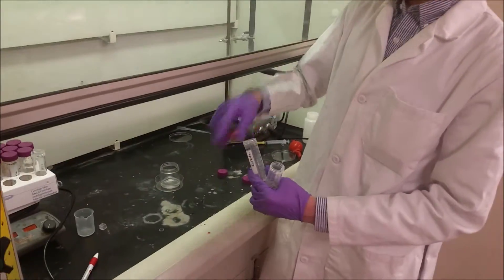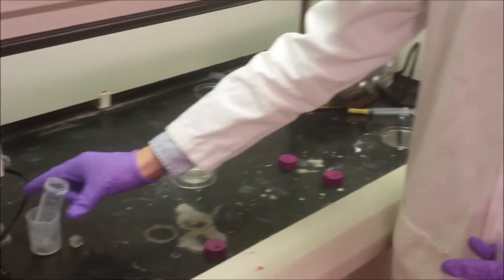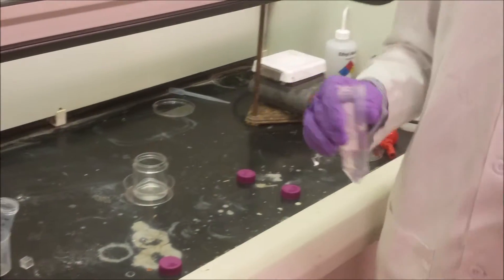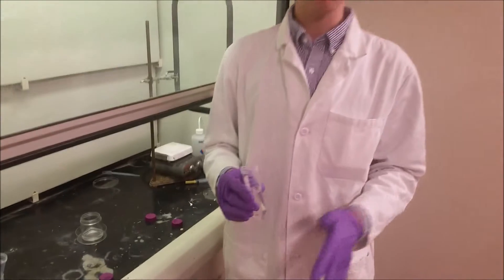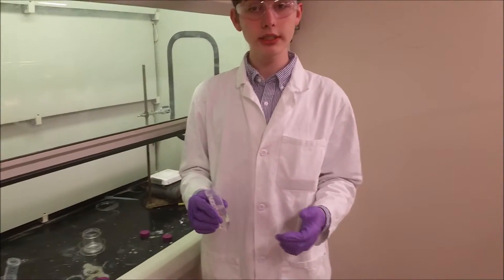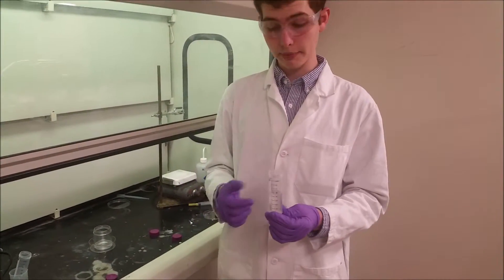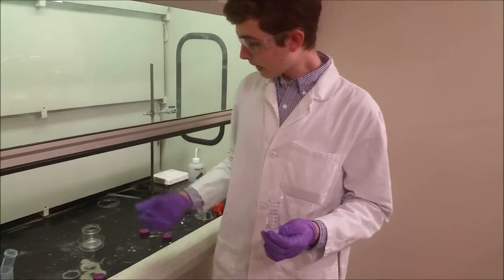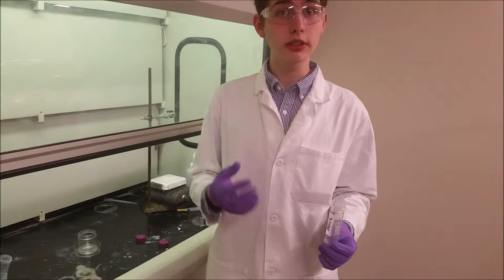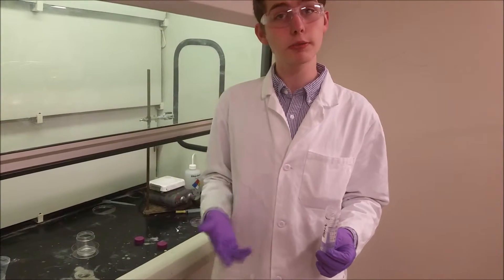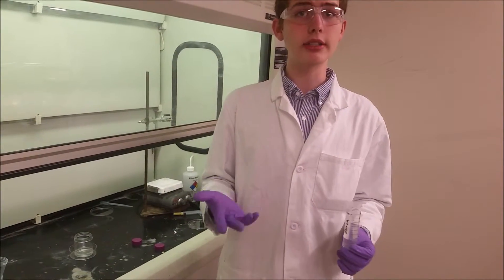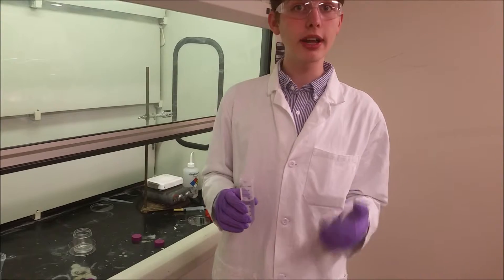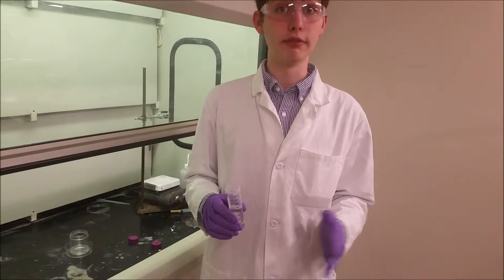We're just going to open that up and have it ready. Now, you may have heard that you're never supposed to mix different cleaning products. This is the reason why. Because this is bleach, a very common household cleaner, and hydrochloric acid is used in small amounts in some cleaners, but you also have ammonia and other things that can interact very negatively with each other.